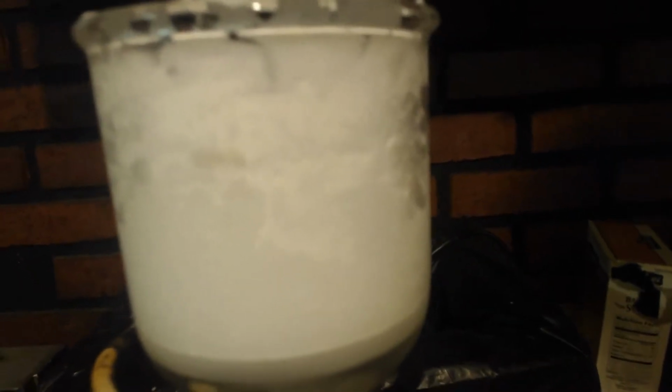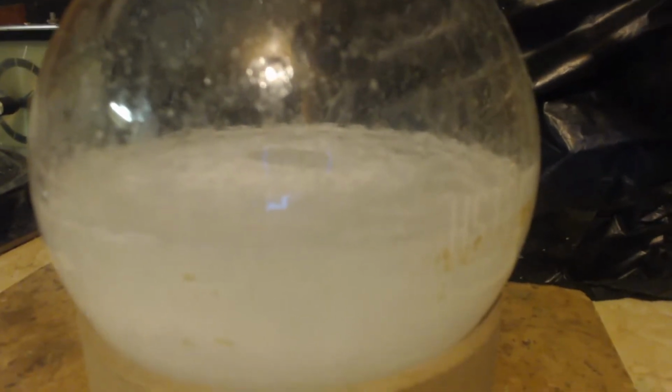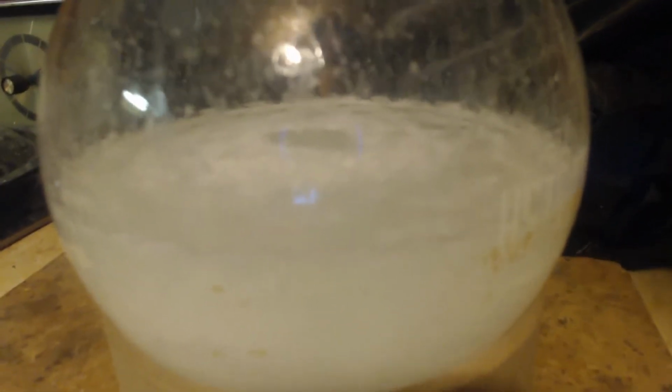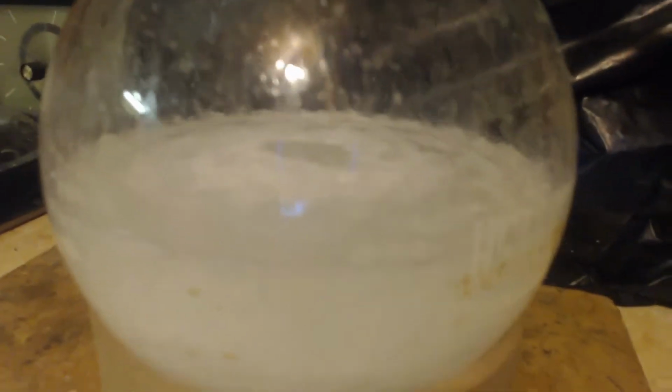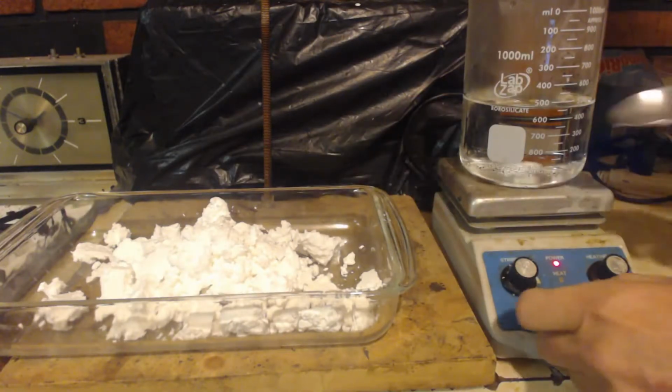Alright, I washed that all up with that 1,000 milliliters of freezing cold water. Sucked as much water out as I could with my vacuum pump. And now this pot here, this stuff that got filtered through, I'm going to put that in the freezer, let some more precip out, and do the same thing with that. Wash it up with some water, try to get it clean, because there's still some more stuff in there. Well, there it is. I got my stuff.